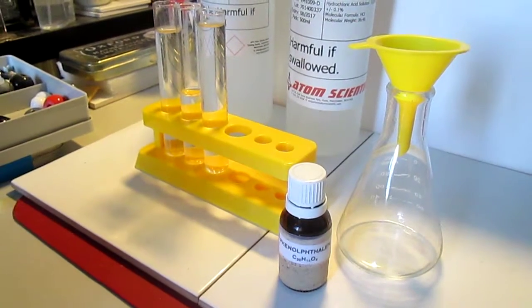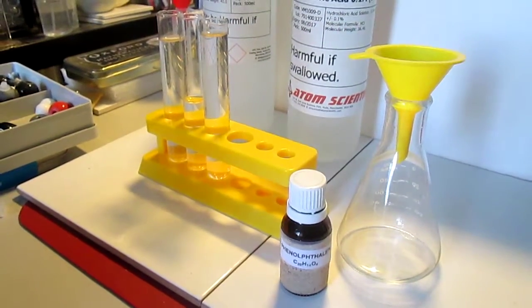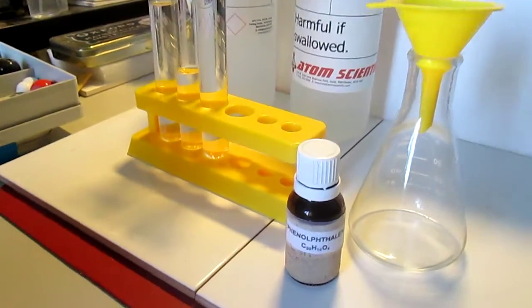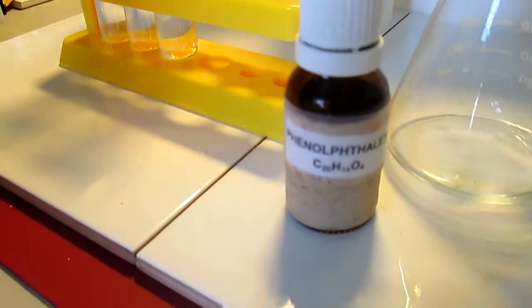In this experiment I will demonstrate how a chemical compound phenolphthalein is used to determine if a solution is an alkaline or an acid.